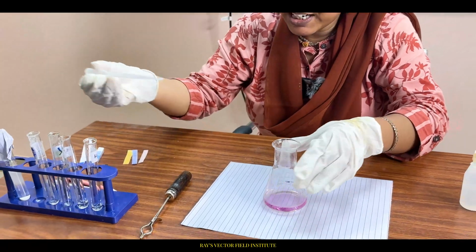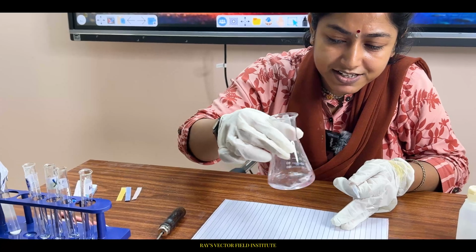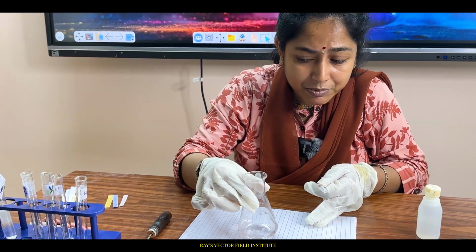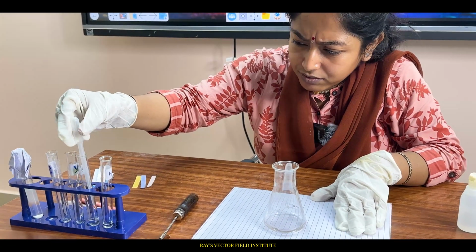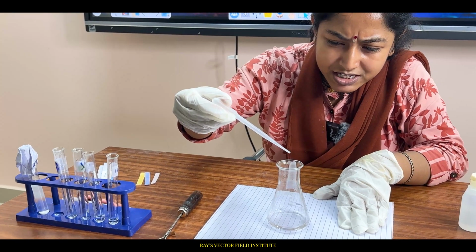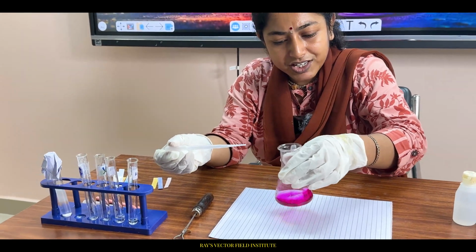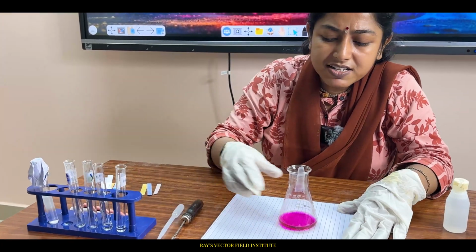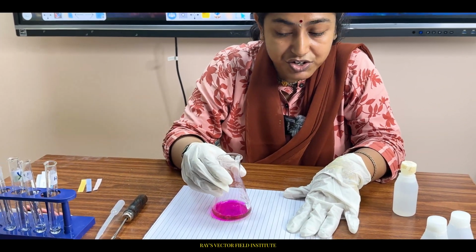Students, please be focused. This is a very important juncture. You might not be able to see what I am able to see right now, because it's slightly pink, which you cannot see in the camera. But when I add just one more drop of liquid Y, see the color change, and it won't go now. This marks the point of equivalence in acid base titration.